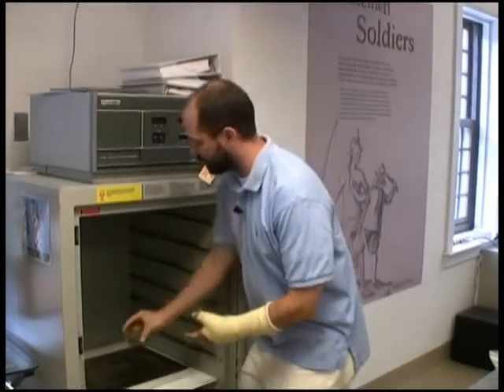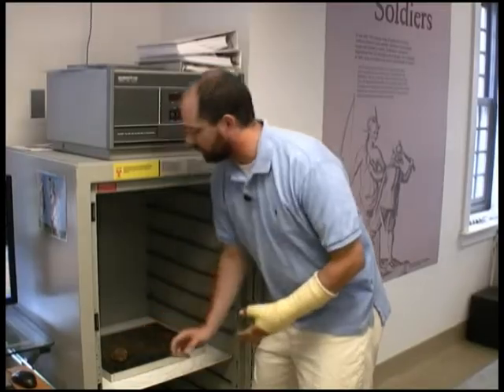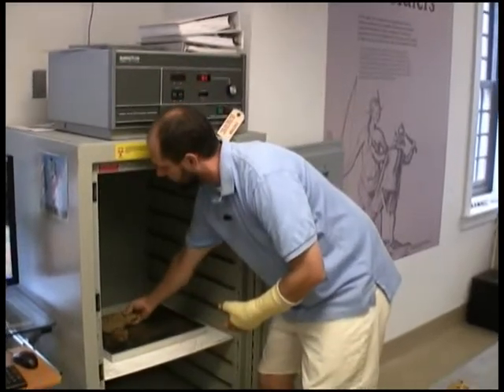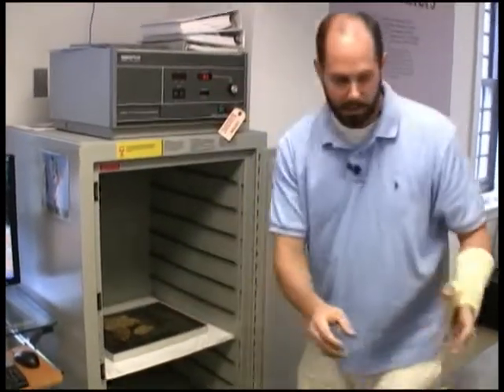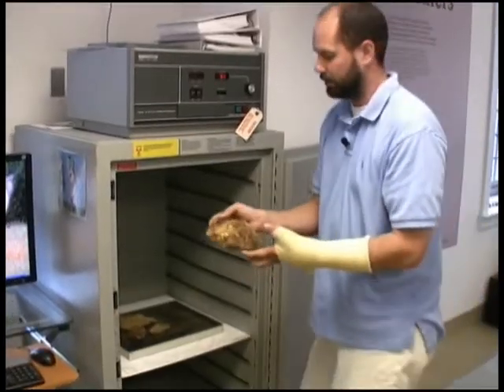Since this is just one small object, I'm going to put a couple of other items on this digital x-ray plate. Here's the mason's trowel. I don't know what this is yet but we'll find out. And this is a unique item which might be part of a buckler boss or a shield.